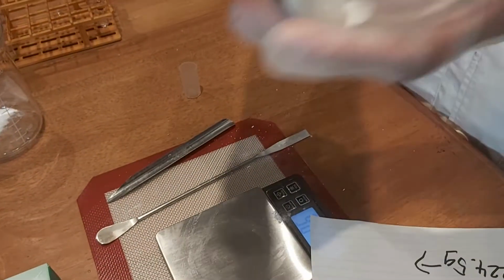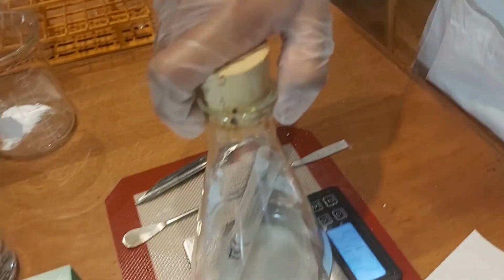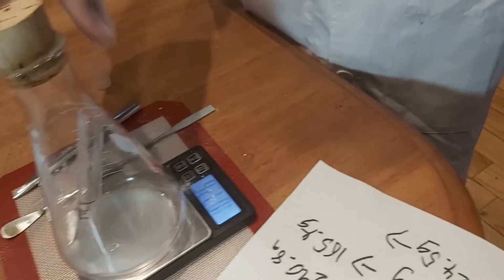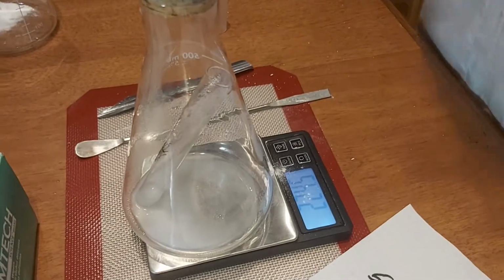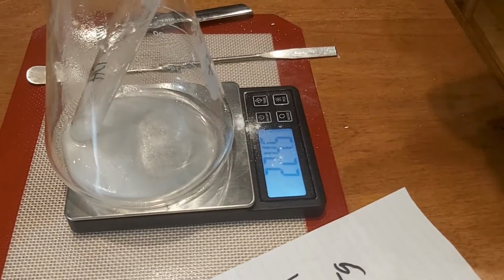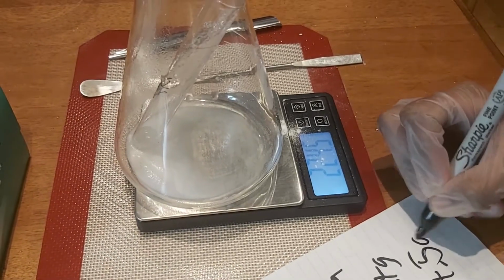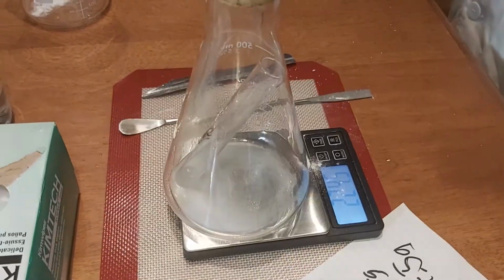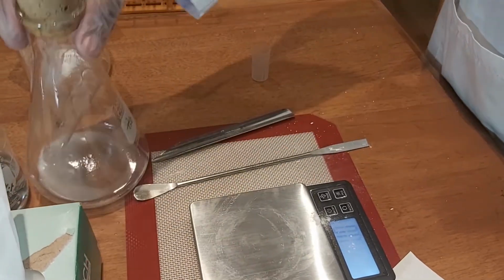You can see the fizzing. And did any mass change? Not significantly. No, not much mass changed. You can see there's 224.5, the exact same mass. Even though this is a neutralization reaction and gas would have escaped had it been an open system, no mass escaped because it was closed.